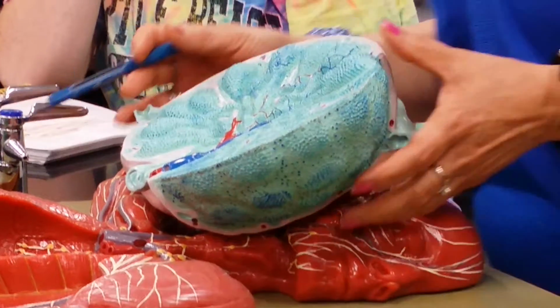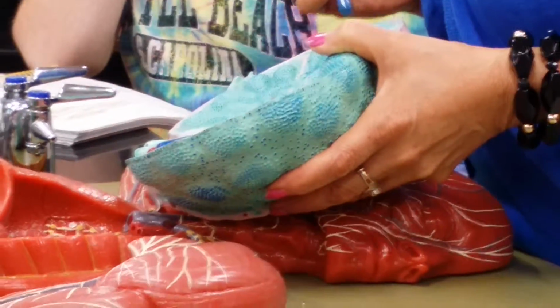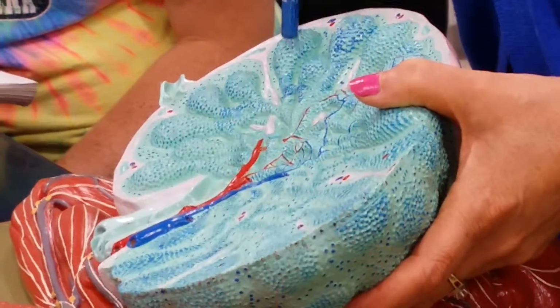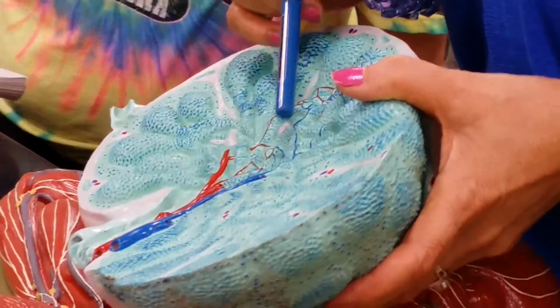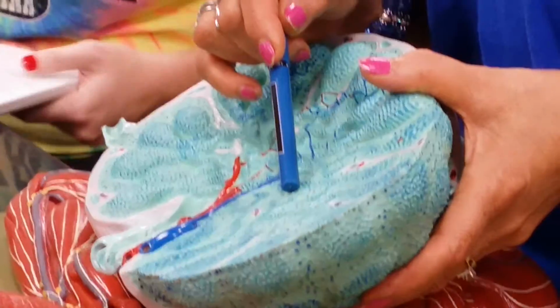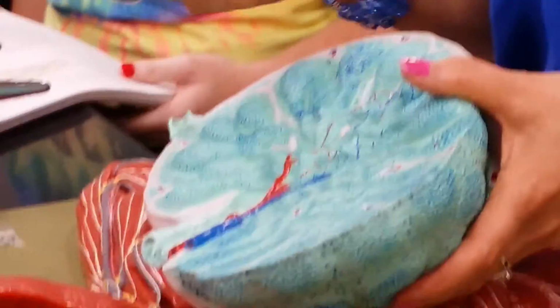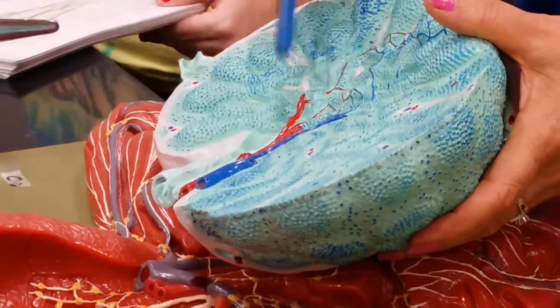For example, if you pay attention here, this is a cortical nodule, this is another one. Between the two there is a space here. See that? This space is in the cortex, therefore cortical sinus. This is a medullary cord, this is another one. Between the two there is this space, which would be called, complete this answer, medullary sinus.